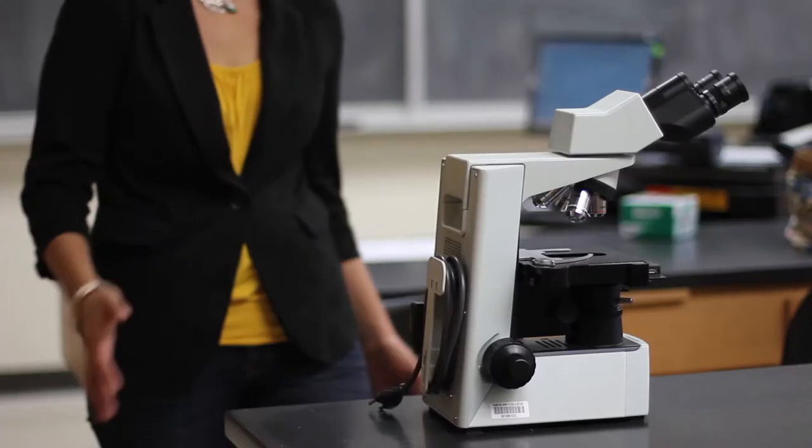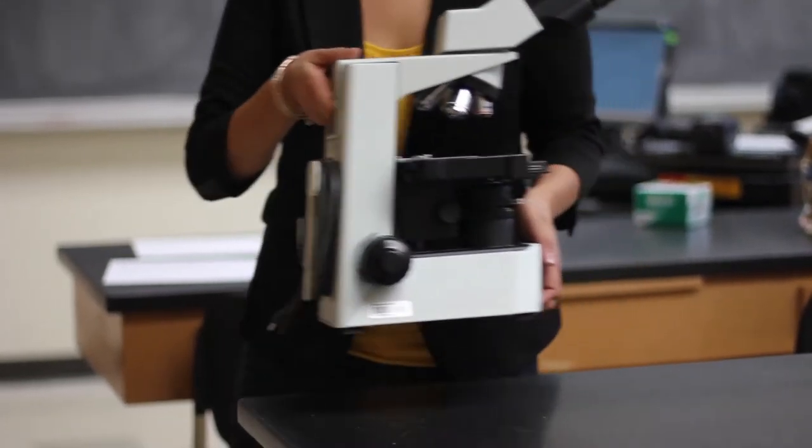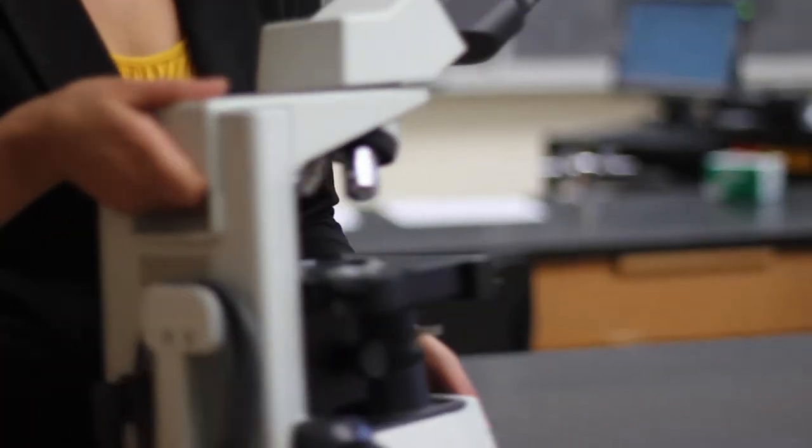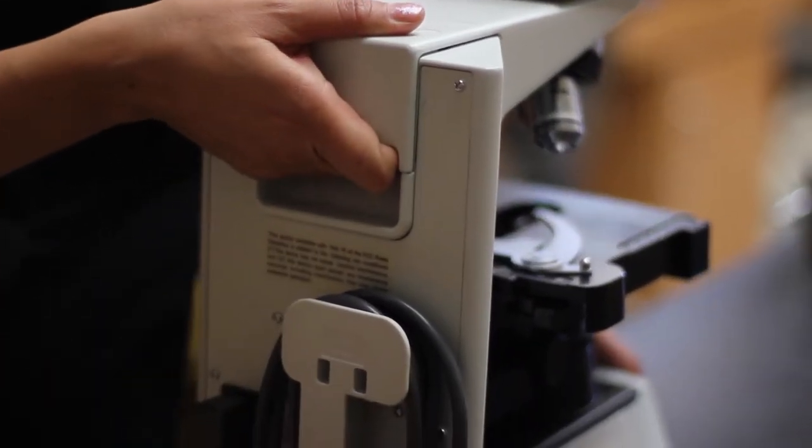When carrying a microscope, always use two hands. One hand should be firmly grasping the handle on the back of the arm or frame of the microscope, and the other hand should be supporting the base.